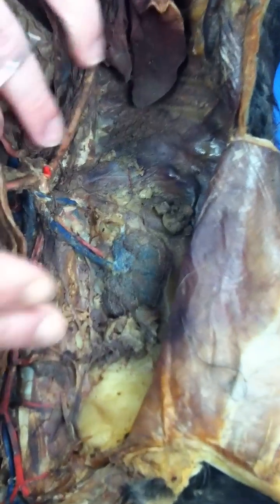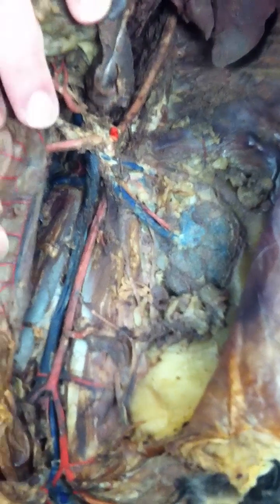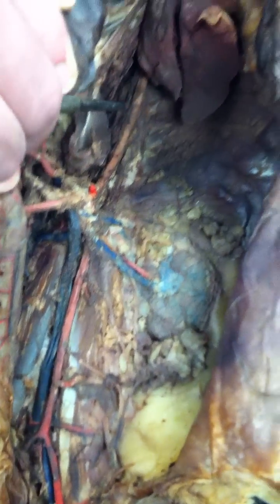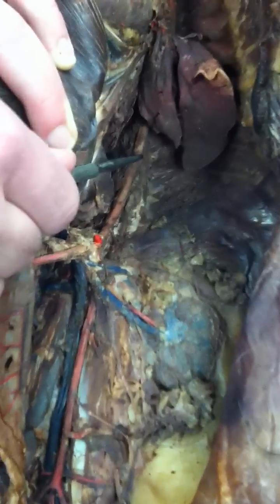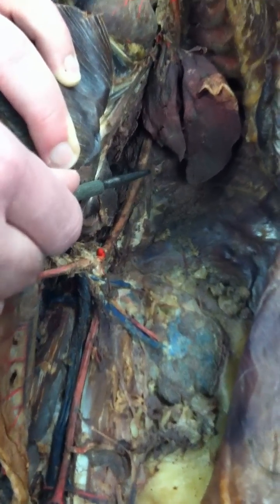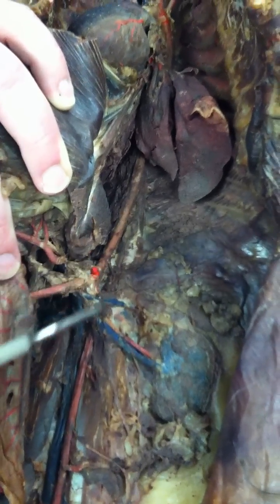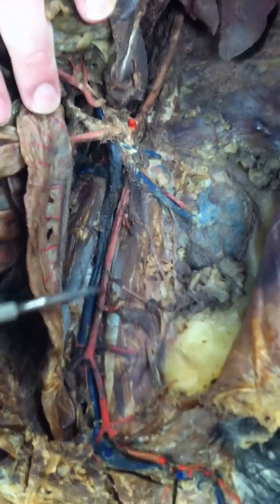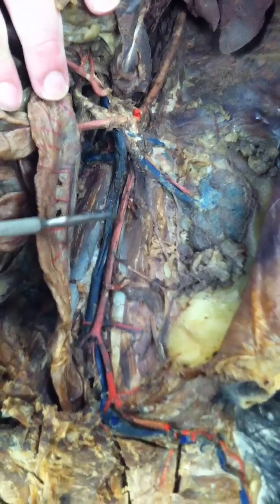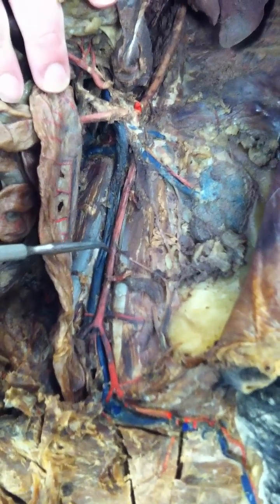We're now going to move down to the lower part of our cat, so I'll flip the innards out of the way so we can make out a little bit more. Right up here we can see the descending thoracic aorta — you'll notice it's very white because of the wall thickness. We follow it down into the descending abdominal aorta, working our way down into the lower part here.